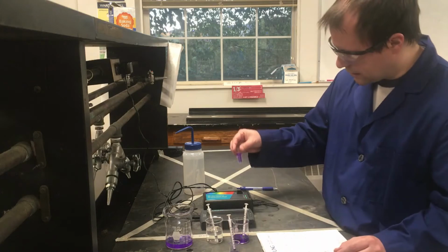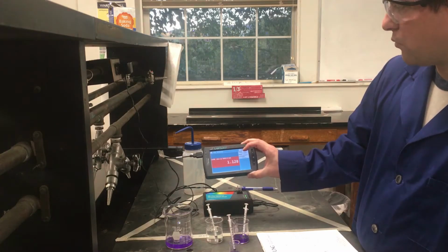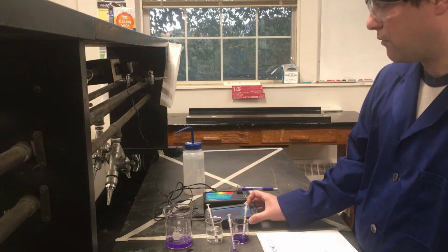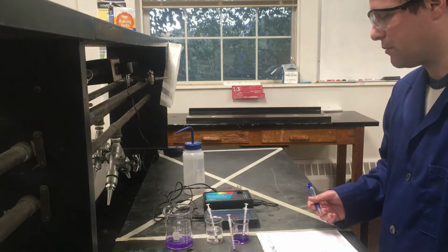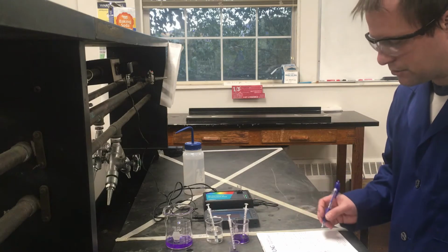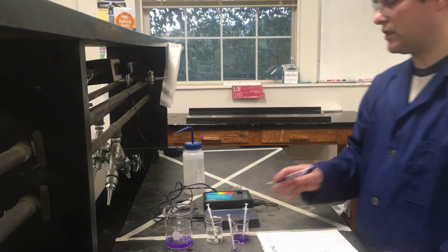So I can go ahead and take a look and make sure I have it lined up properly. Put it in, look at my spectrophotometer. Looks like I get an absorbance of about 1.1, around 1.129 or 1.130. It's been bouncing around some, so I'm going to give it a second to stabilize. And it's back up to that 1.129, so I'm just going to go with what that said originally. So 1.129. So that's my absorbance for the second one.